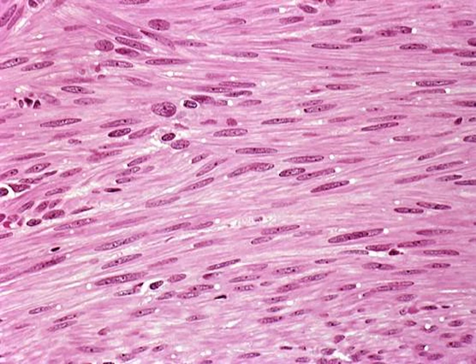Here you can see another look at a lot of smooth muscle cells. These dark spots in the center are the nuclei of those smooth muscle cells, very tightly packed here in this picture.